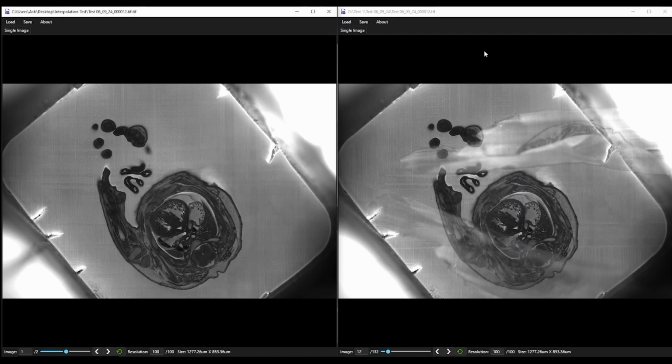In this tutorial, we're going to go over how we create an interpolated image from a HREM dataset. On the right we have a raw HREM image, and what it has is some debris on the surface from sectioning. This is quite a rare occurrence, and it's usually if things aren't set up right, but this is a good example of a situation where you would use the interpolation feature.